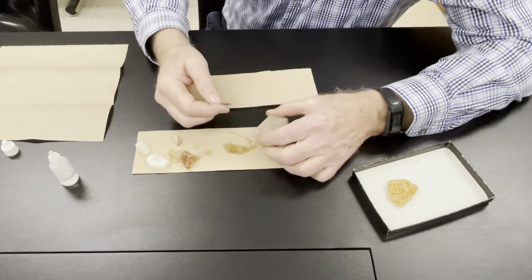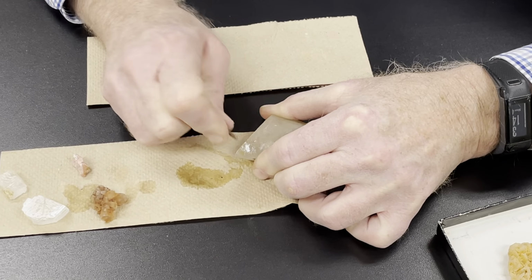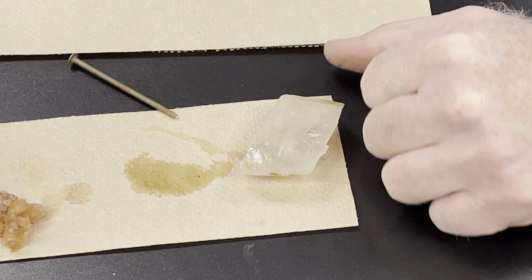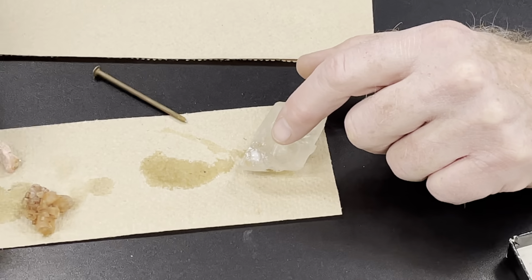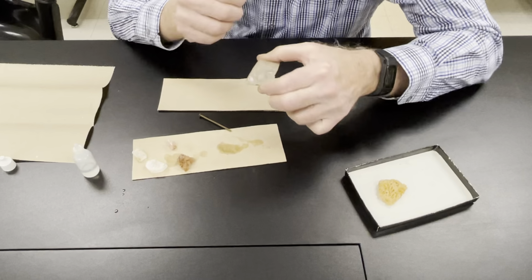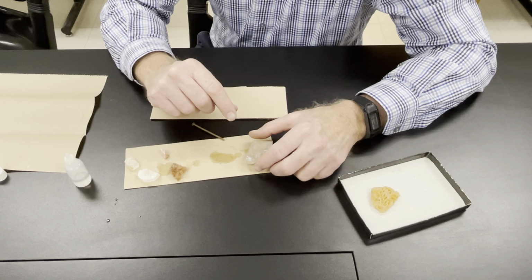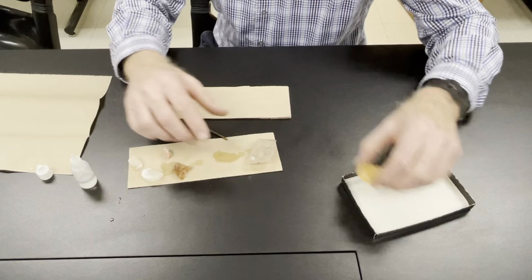Let's scratch some up. This has been done before. I'll put it on the scratched area. And yes, there is some reaction of the scratched dolomite. So it is very helpful to have a hand lens when you do these tests, because if I had my hand lens, I could go like this and focus in and see those bubbles really clearly. I don't have it with me today, but it's a very useful tool to have, hand lens plus acid. Okay, let's try it on this stuff.